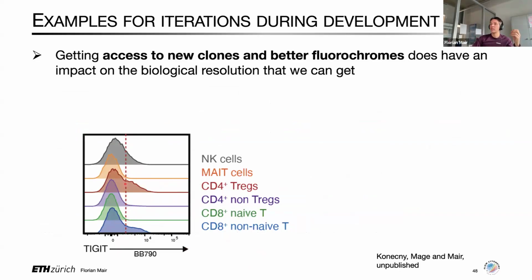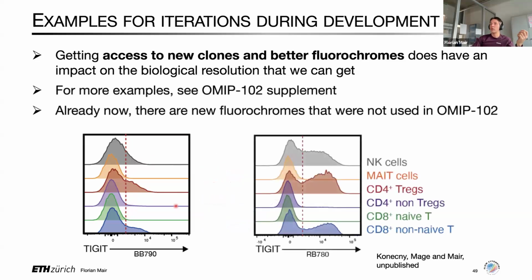And here, this is really an example where we went from one panel iteration, I don't know which panel iteration, but anyhow, we went from here to there. And all that we changed is actually the clone of TIGIT, and we switched from Brilliant Blue 790 to the newer Real Blue 780. And you can see that the resolution that you get is really like day and night, where here you have nice bimodality on the Tregs, nice bimodality on the effector CD8s.